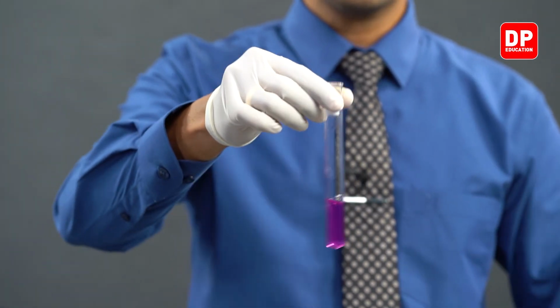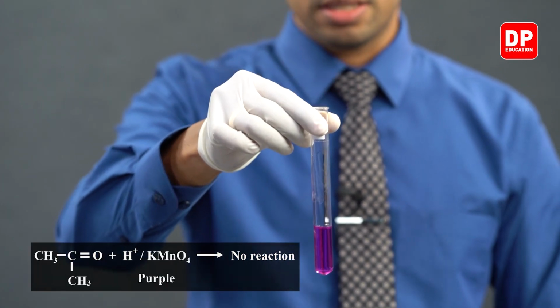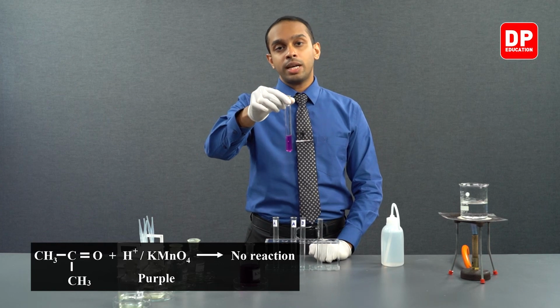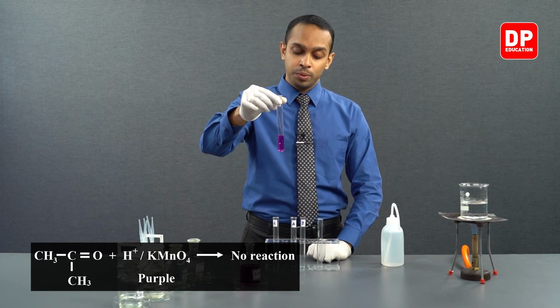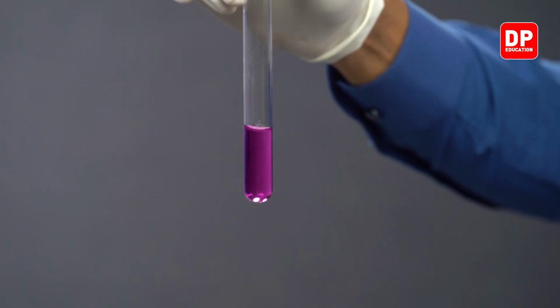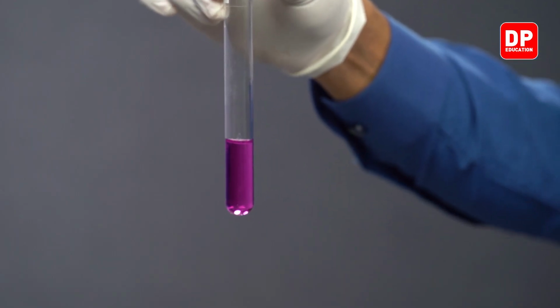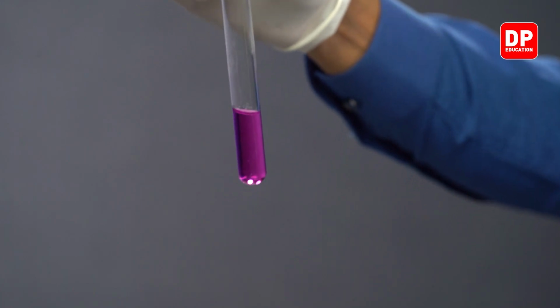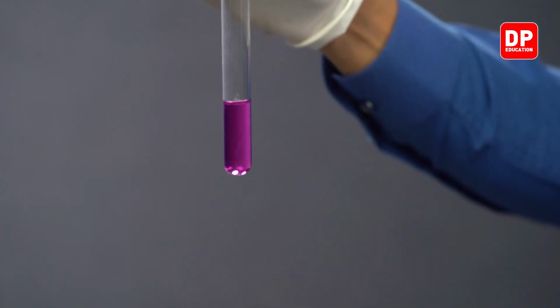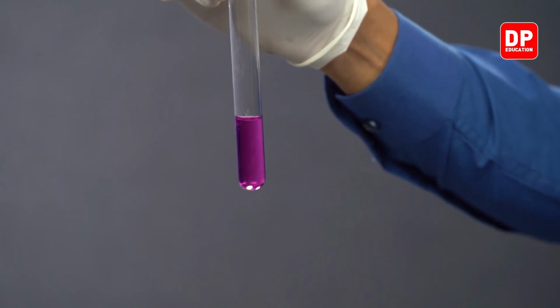So unlike in the previous example, when I added acidified potassium permanganate into acetaldehyde and we saw potassium permanganate got decolorized, here we still see the color of potassium permanganate. This could be due to two reasons.